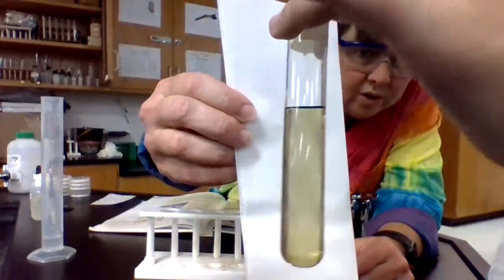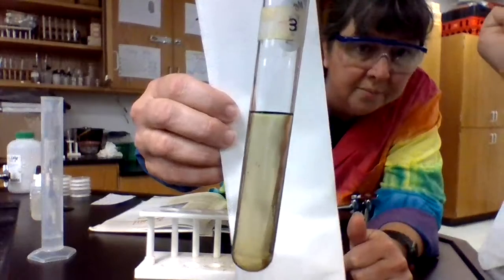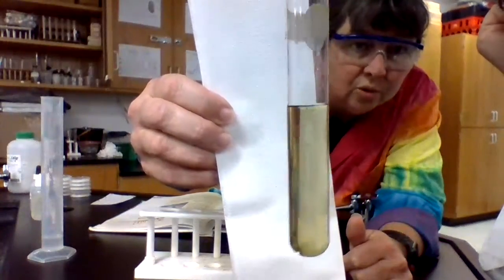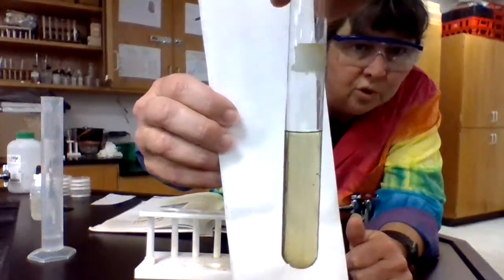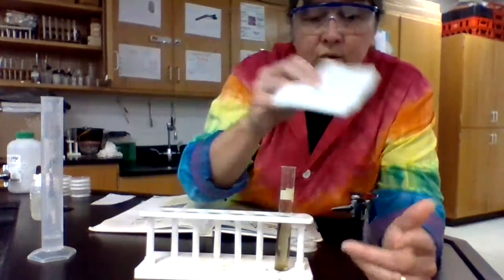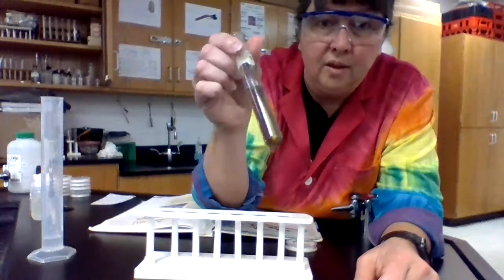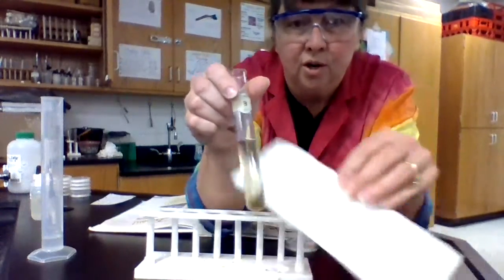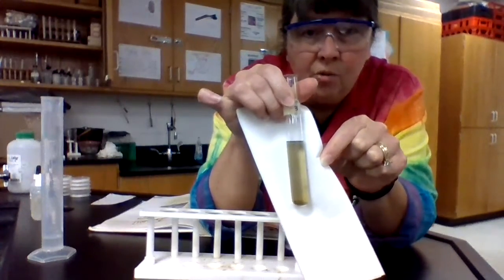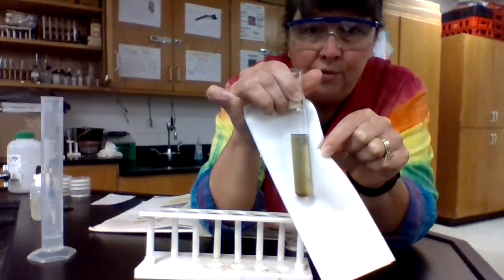Just like one of the other compounds in the other part of the lab, this one is starting to turn dark. It's not staying that nice yellow clear color. It is starting to form a very dark color. We're going to let that sit just a few extra minutes so that you can see it turn. If you notice that it's turning this dark color, that would be a stopping point in the lab if you're looking at the flow chart.